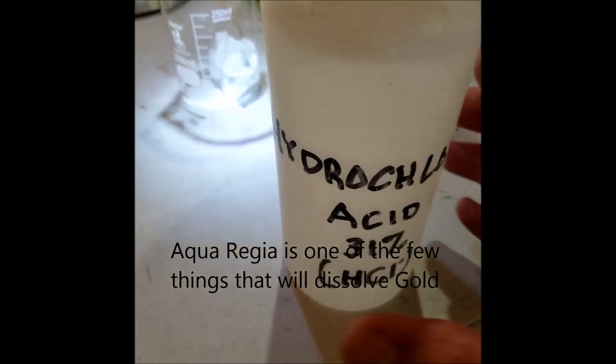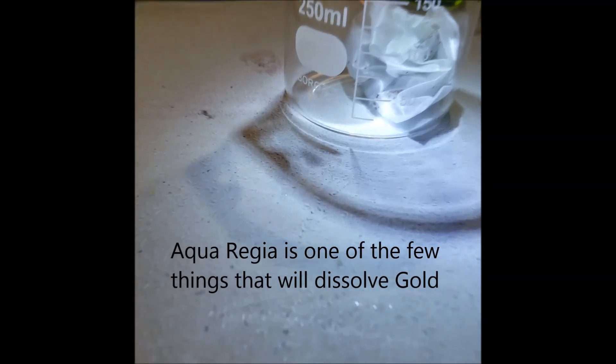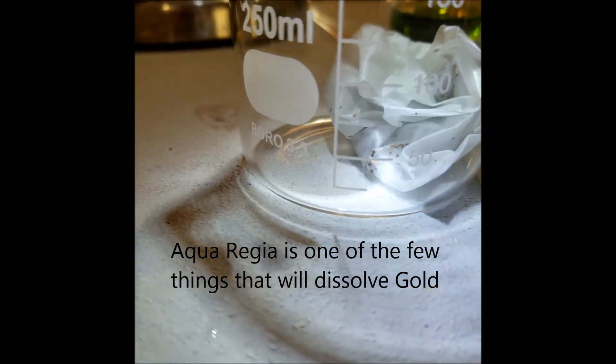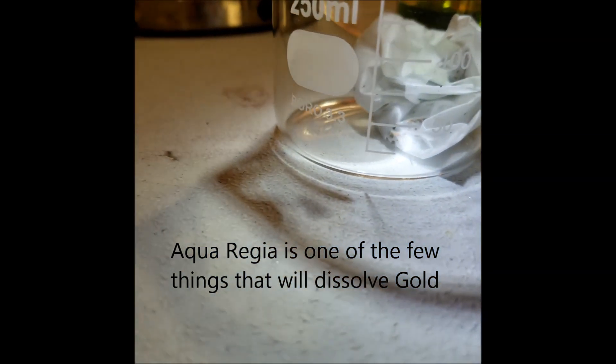We're going to use the hydrochloric acid. We're going to add 50 mLs. You can't see it very well, but there's 50 right there.